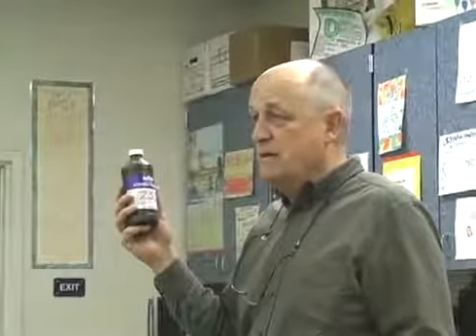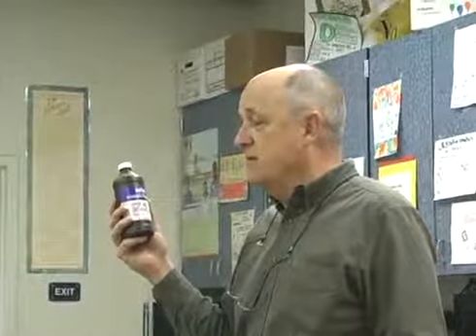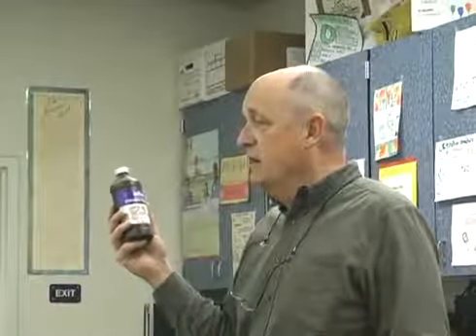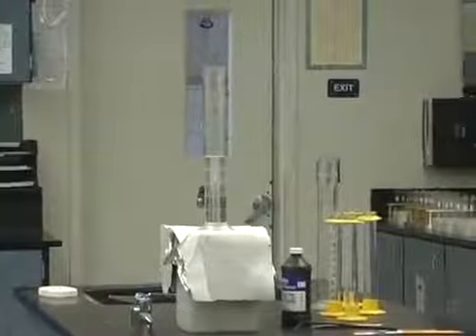So if Grandma leaves the hydrogen peroxide bottle on the windowsill long enough, it would just turn into oxygen and water. But it's really boring, as you can see. It just kind of sits there. Okay. So what we're going to use is a catalyst to speed the reaction up. Now, what does a catalyst do? Yeah, it speeds it up.